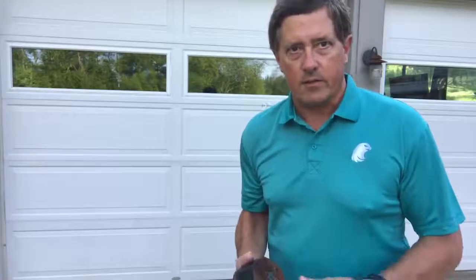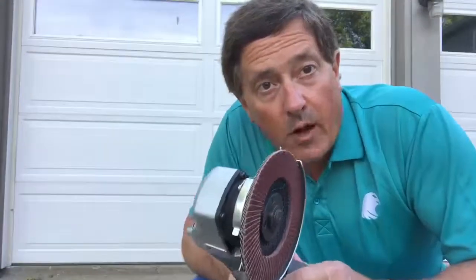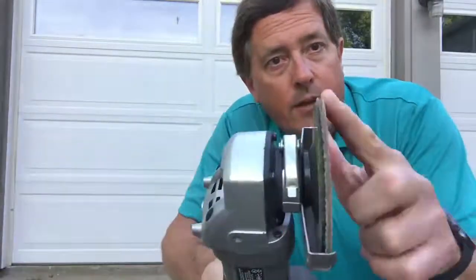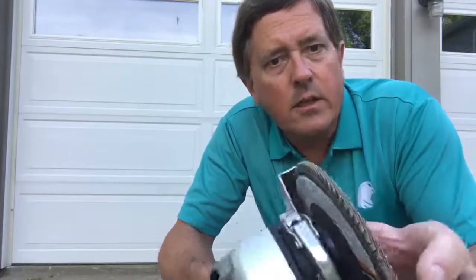Same thing goes for coatings or paint, oils, grease, dirt, anything that's on the surface is going to interfere with the test. So what makes this exciting is not the rust, it's power tools. So on the power tool, it's just a battery powered angle grinder. And I have a flapper wheel, 120 grit, which generally gives a good enough surface preparation for most hardness testing.